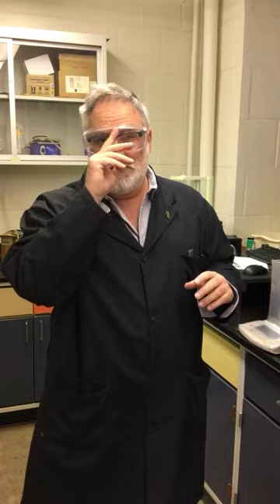A very small portion, 3 cubic centimeters in this case, will go off to the infrared sensors. We have separate ones for both carbon dioxide and water. And from those, we use calibrations to know what those values are. Again, the water data needs to be corrected because we have moisture in the sample. It's very high in biomass, so it's not dry. So these are significant corrections to make, particularly as well at low rank coal, where moisture can be quite high.